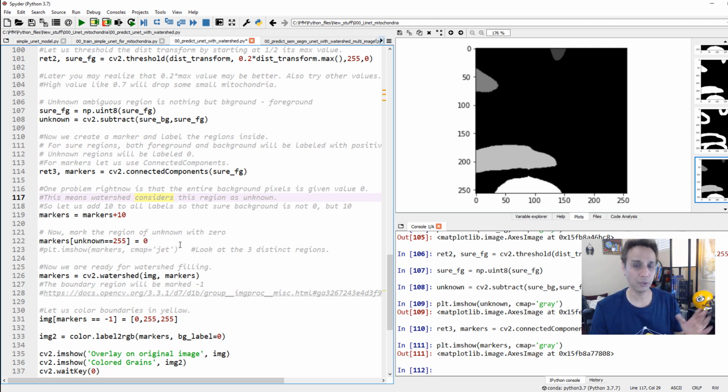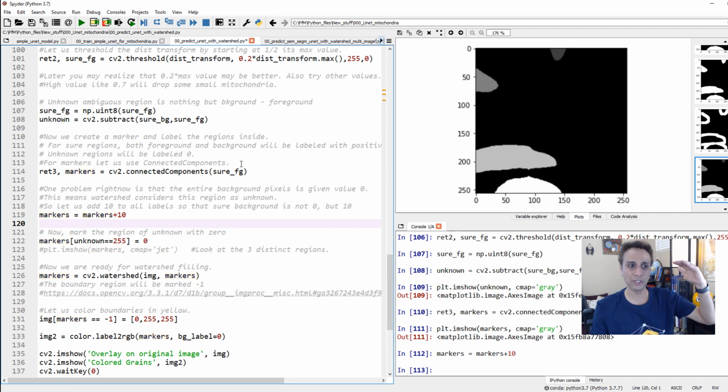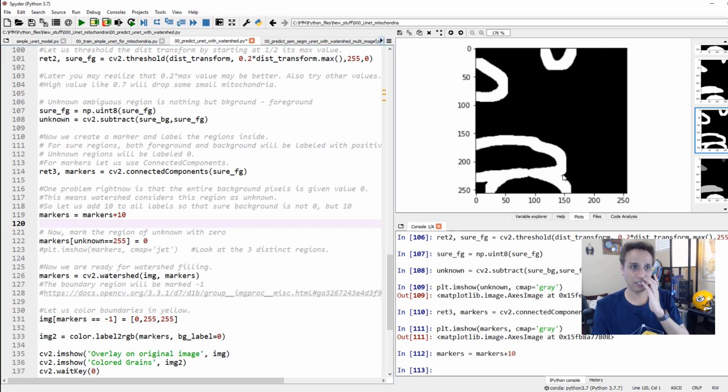Again, please don't be confused. Practice this a couple of times. So to all of our markers, we are adding 10, but we have to convert our boundary areas, right? These areas, we have to convert the pixel values to 0, so Watershed understands how to work with this.